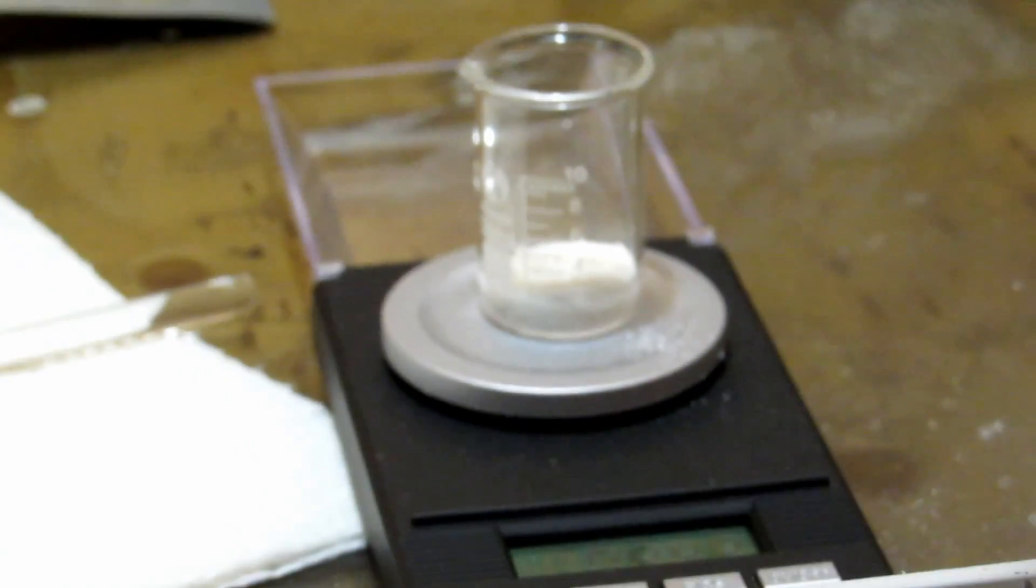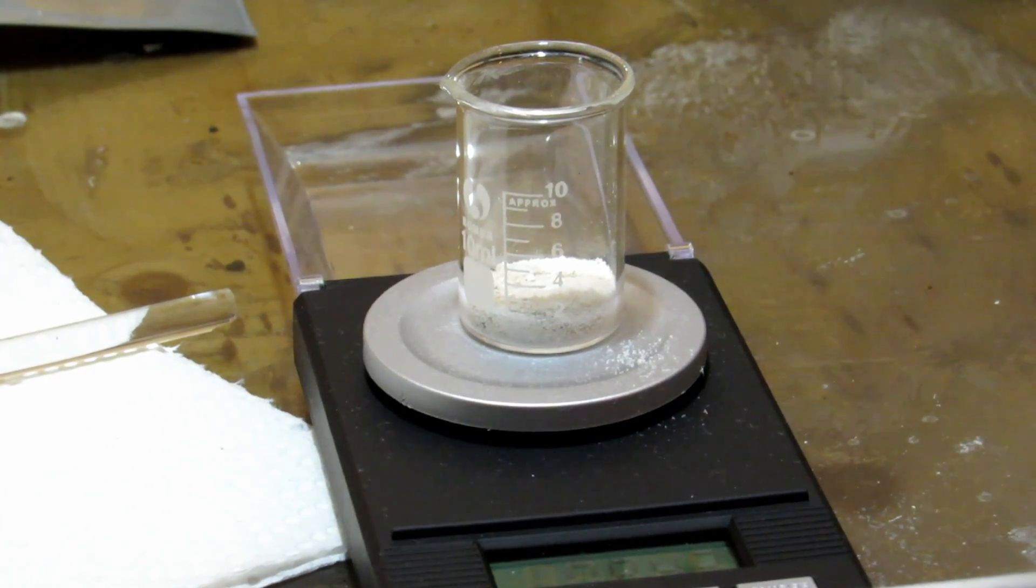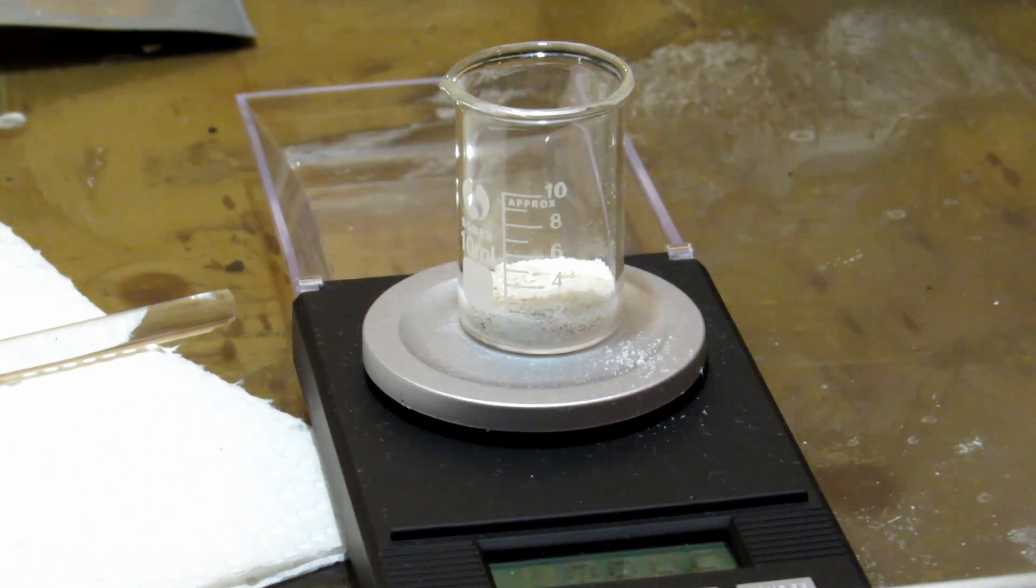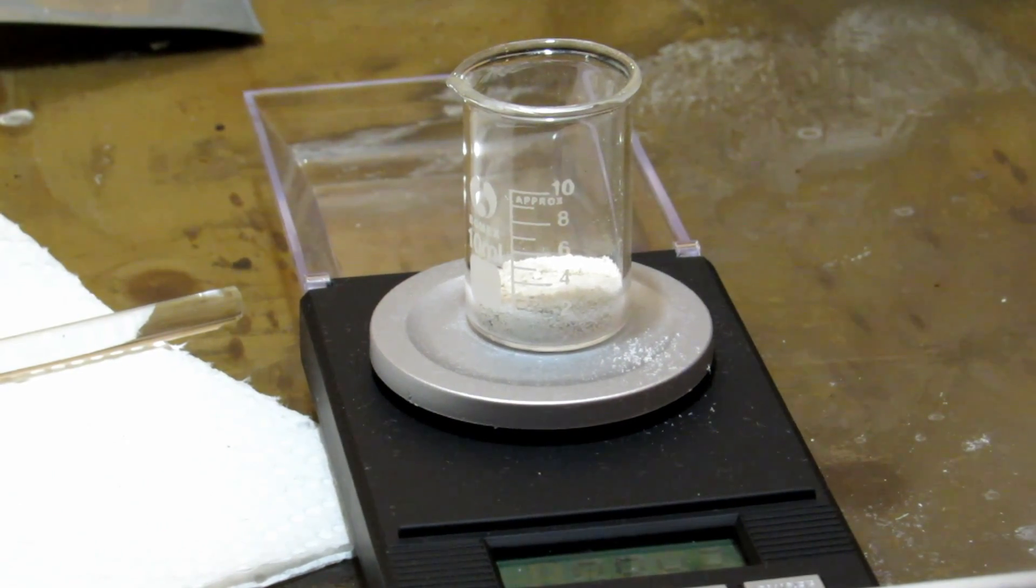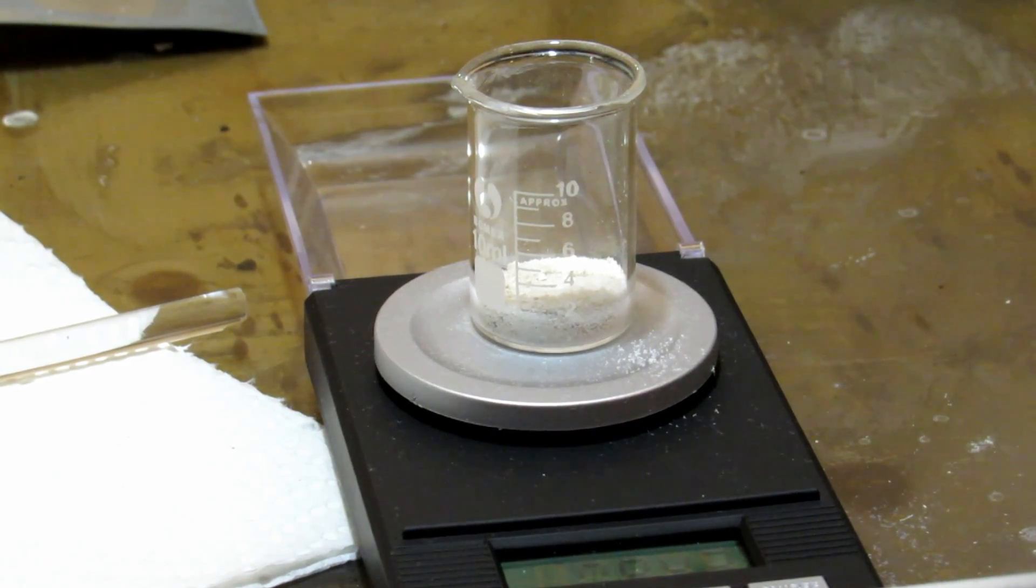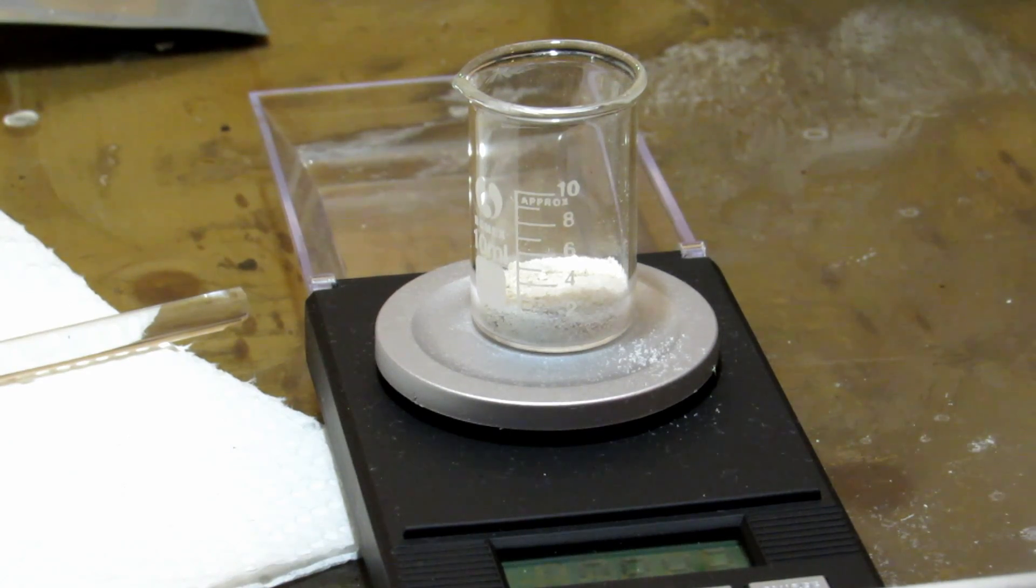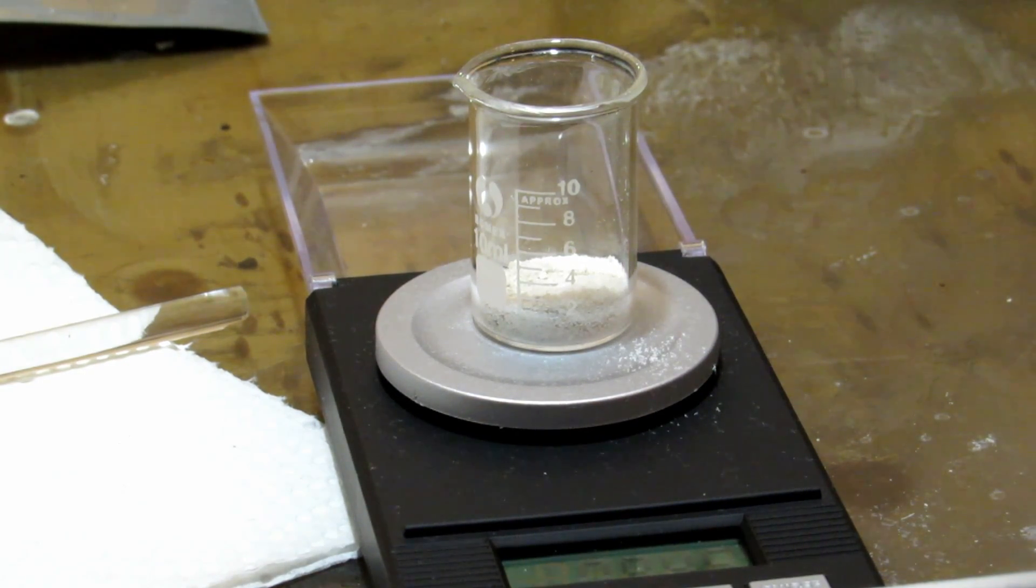There is all of our pure caffeine. It was dried then weighed. I just have it on a scale and it's reading 0.945 grams. So just under one gram of caffeine, and that came from 1,000 grams of coffee. This is definitely a very poor yield.